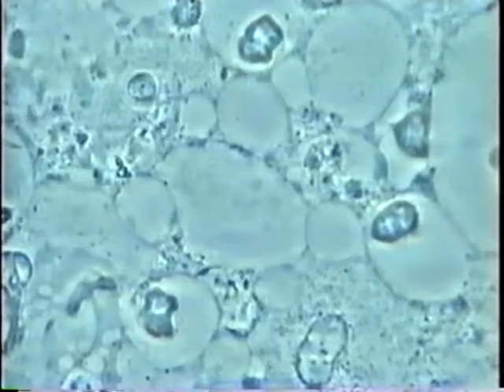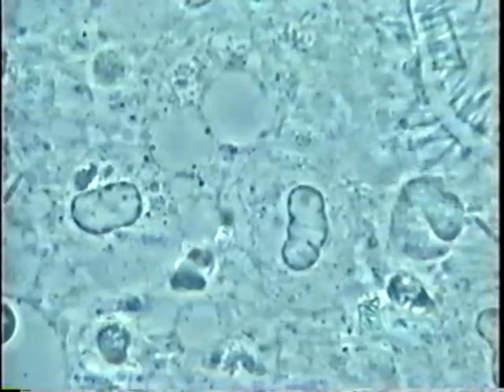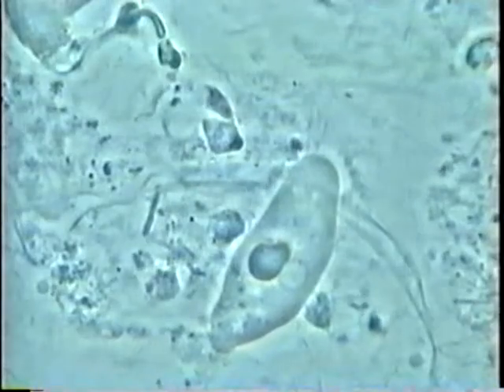Amoeba are feeding on the nucleus of the white cells — really vampire parasites that are very active in the gum sulcus when you have gum disease. We see some baby ones, some with many nuclei of white cells inside, many baby ones on the top right, with a lot of phagocytosis activity going on. Many cells, many baby parasites — they live on this activity.